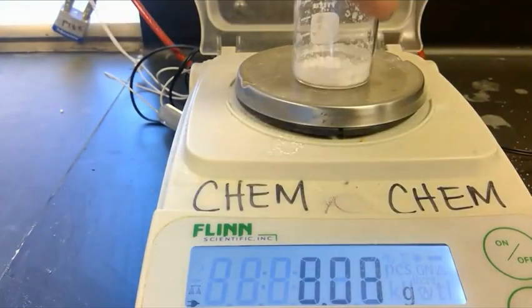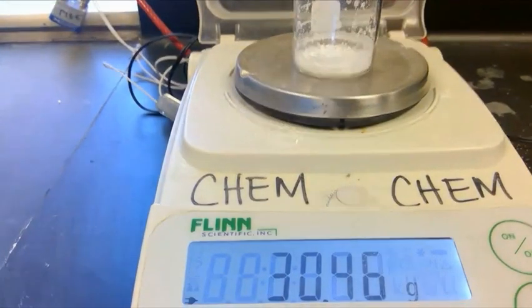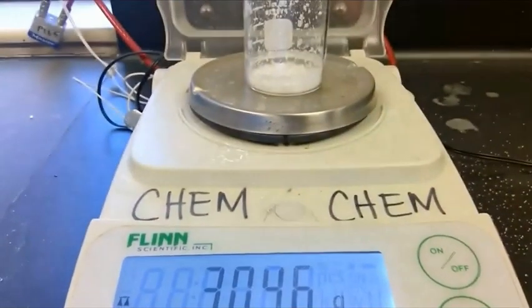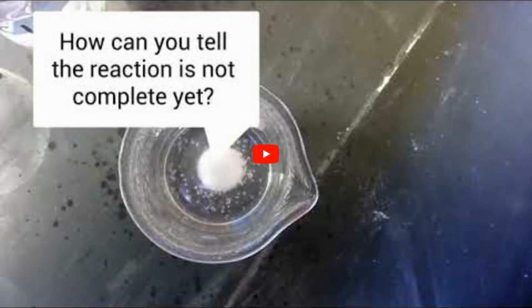So our last step is to get that final mass. And we can see our final mass is 30.46 grams.